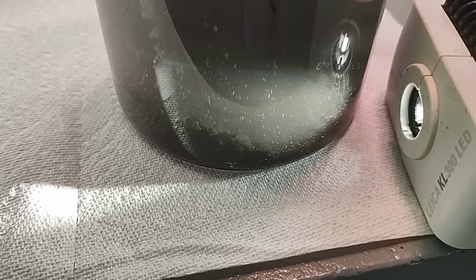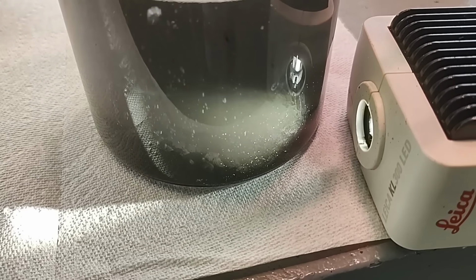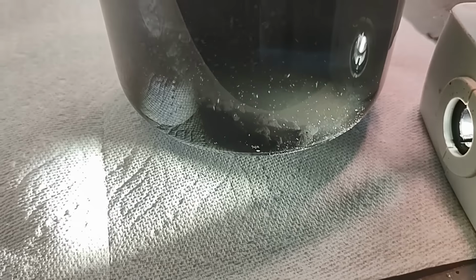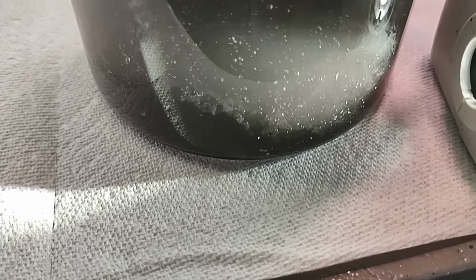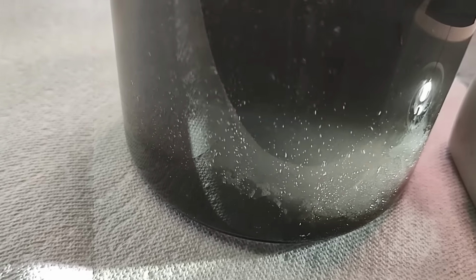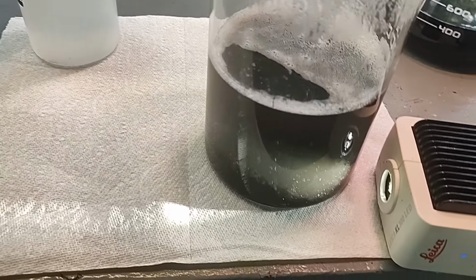If I lift the beaker up a little bit, you'll be able to see light coming through it. Yeah, see that? And see that pile of palladium sponge there? Look at that. You know what? There may be more palladium here than I was thinking. I might just have to bite the bullet and put some more of that ammonium formate solution in here.